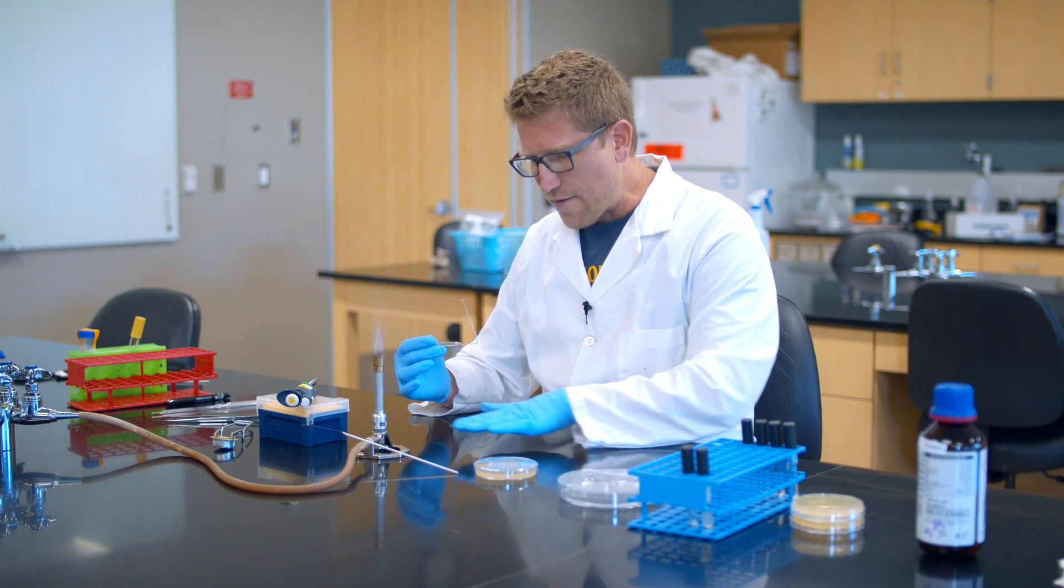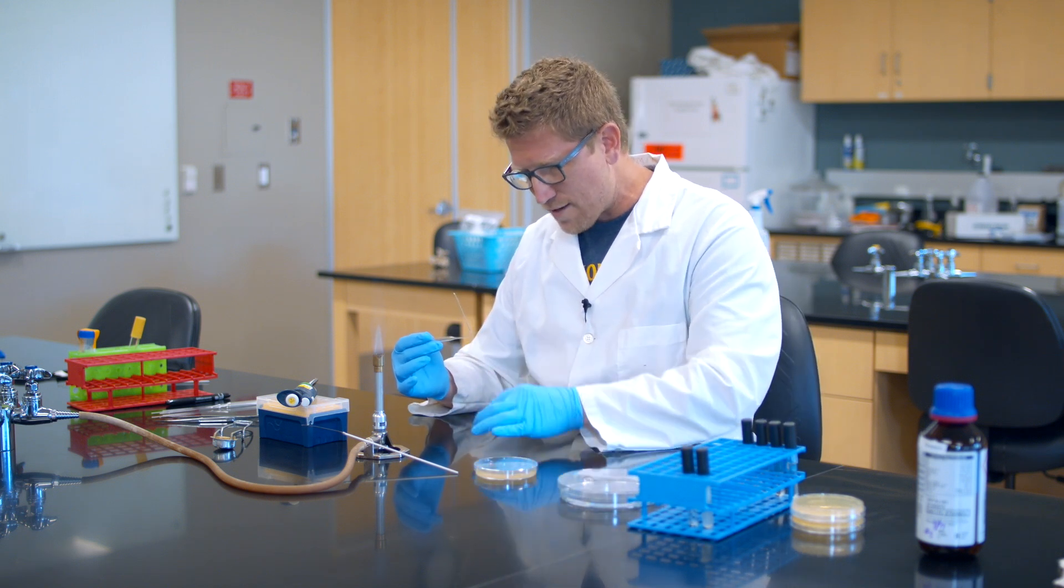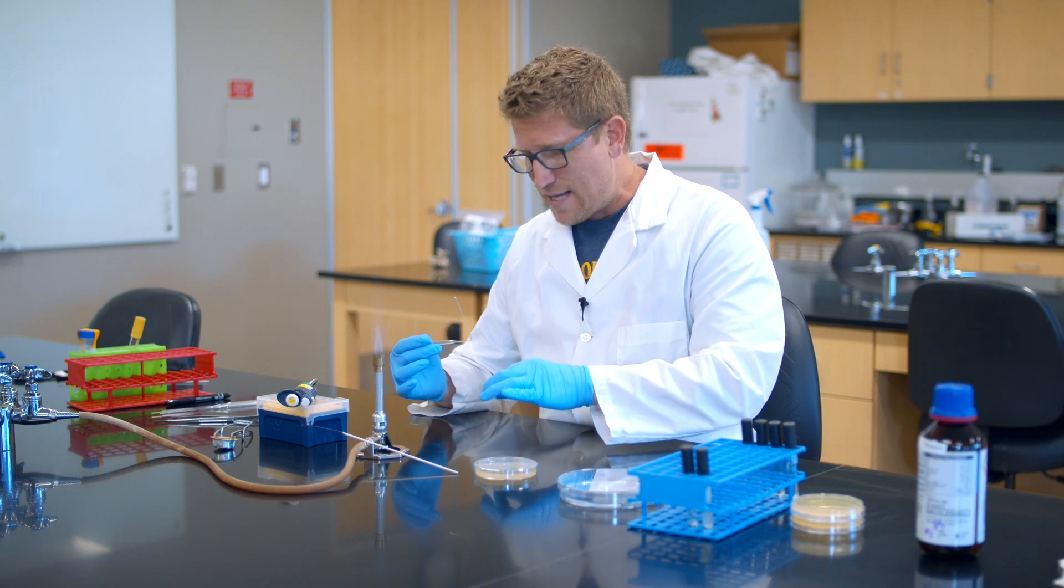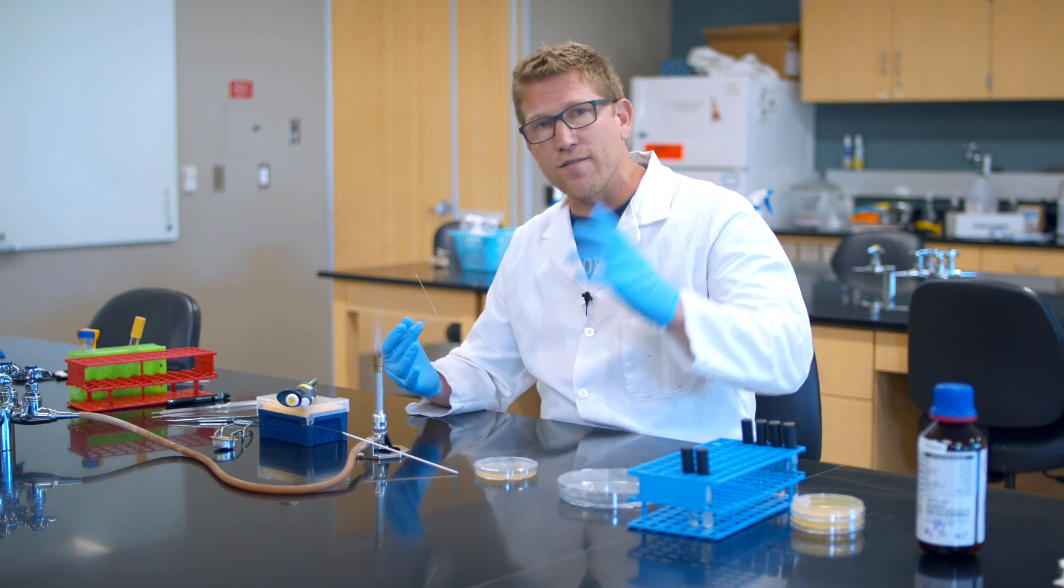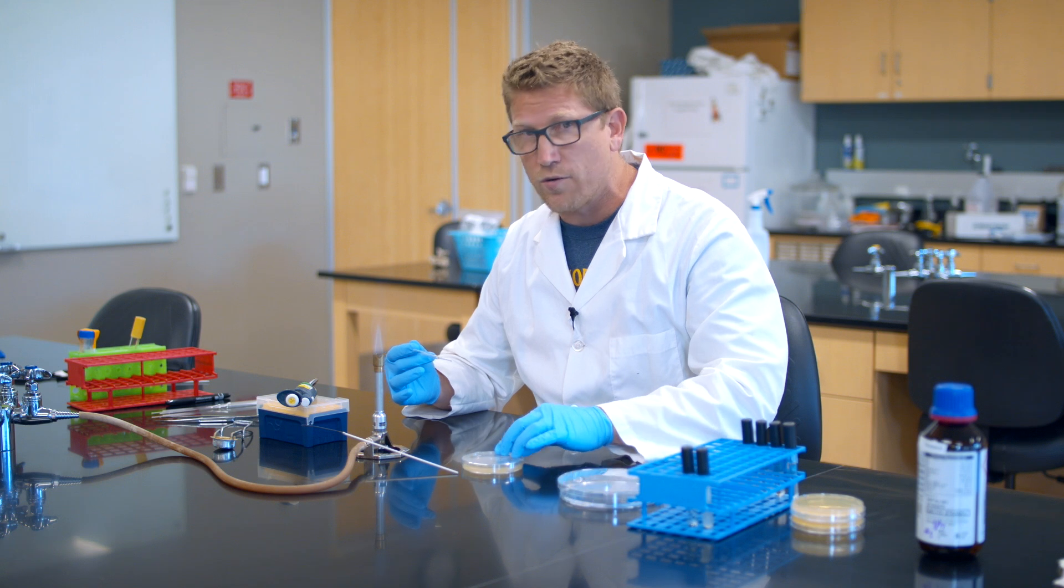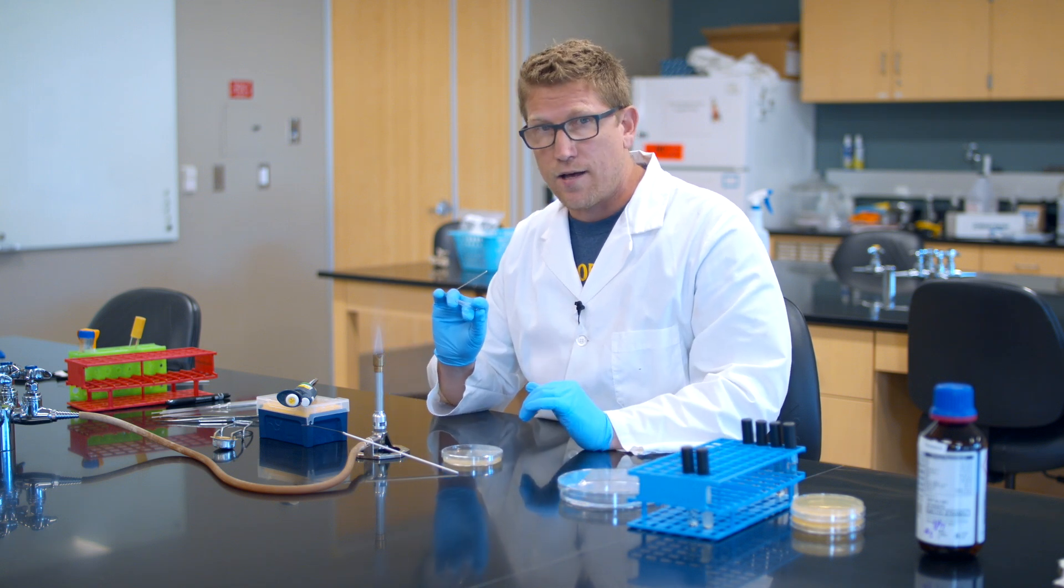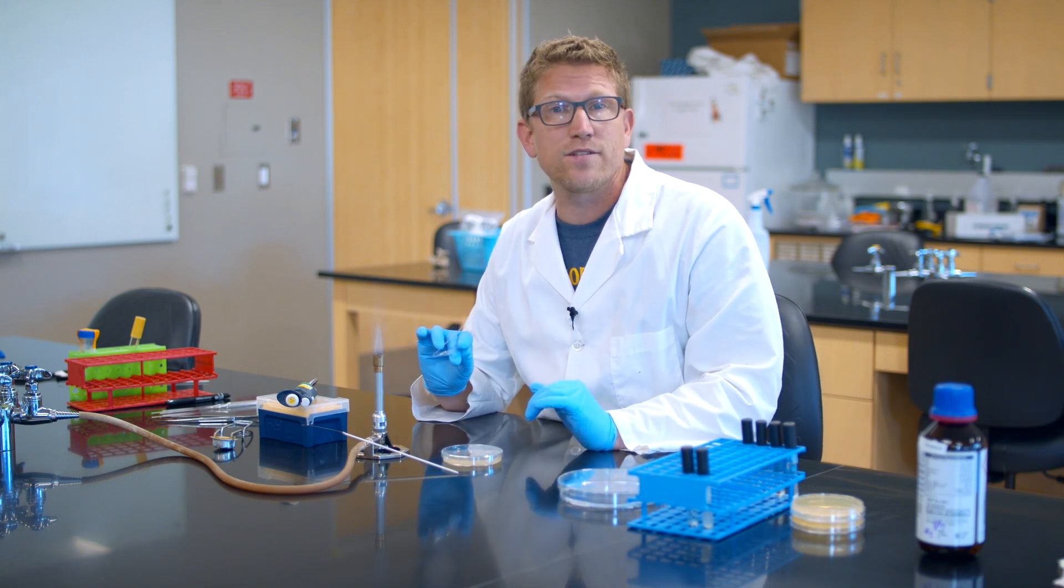You also don't want to have a sheet of paper here. I've seen students have dripping ethanol flames land on their lab notes and everything catches on fire and then everybody runs around screaming. We don't want to do that. So now this glass spreader is disinfected or sterilized.